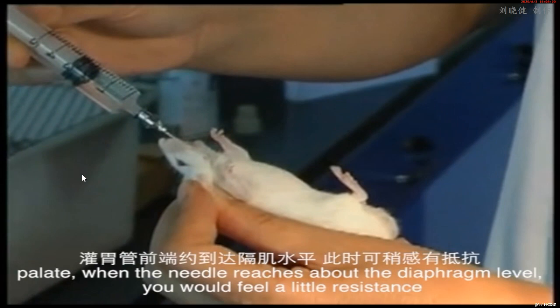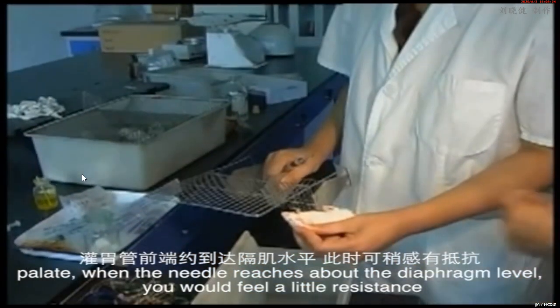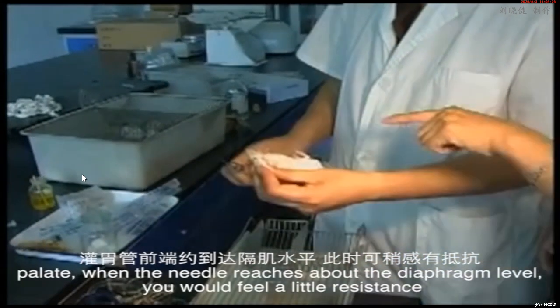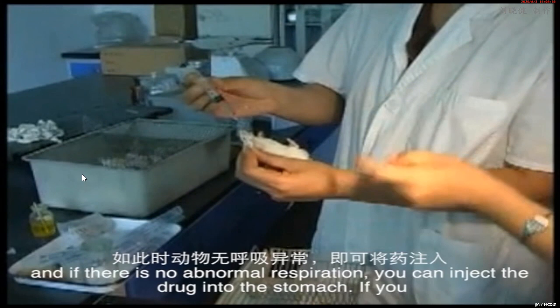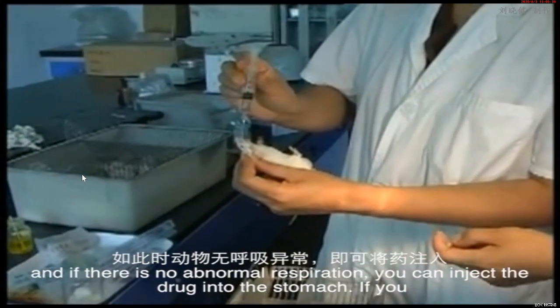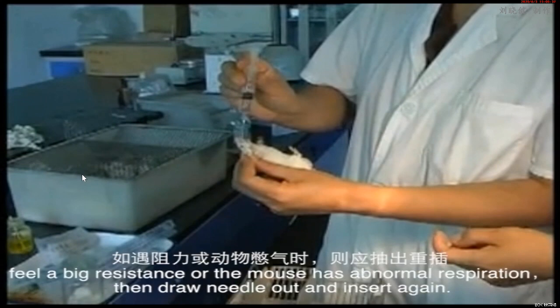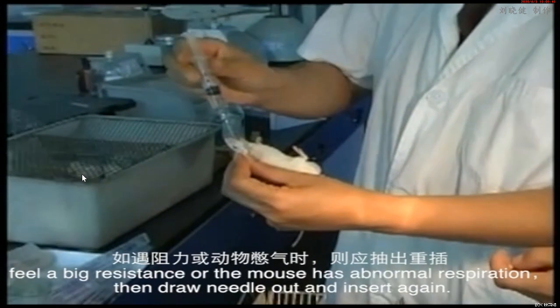upper palate. When the needle reaches about the diaphragm level, you would feel a little resistance. If there is no abnormal respiration, you can inject the drug into the stomach. If you feel a big resistance, or the mouse has abnormal respiration, then draw the needle out and insert again.